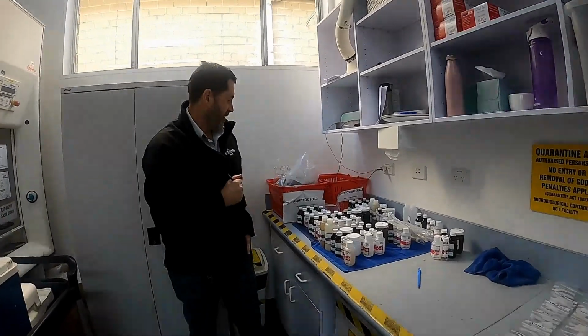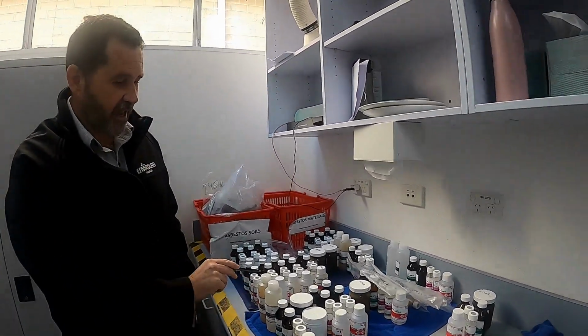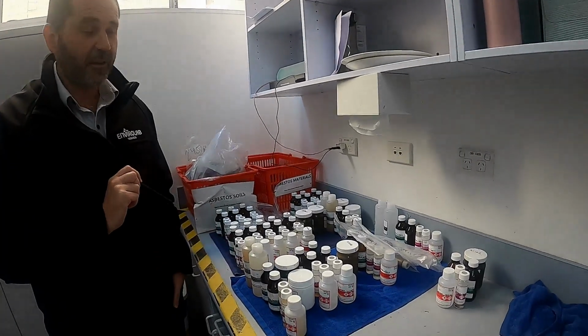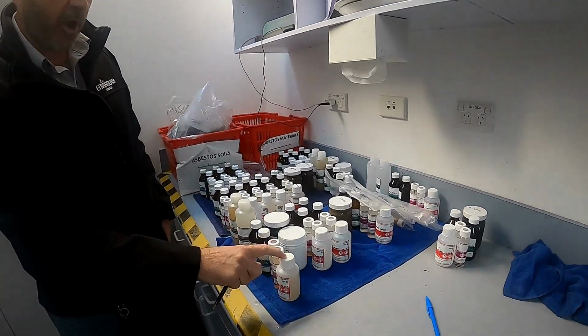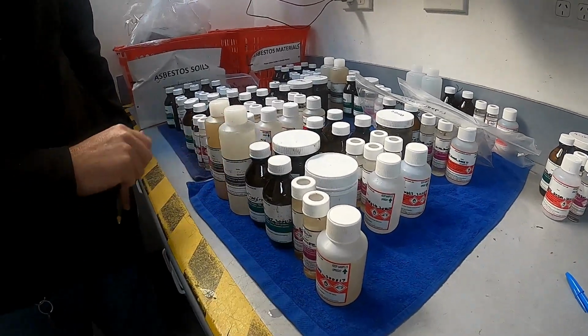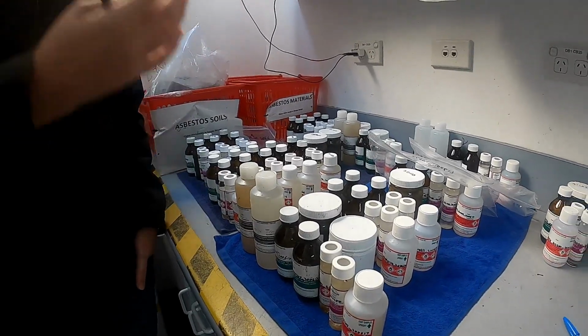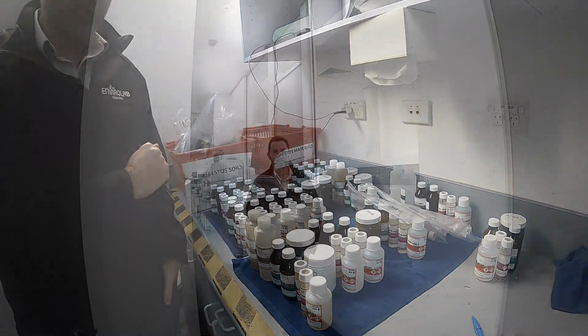Likewise, over here are our water samples. And you'll see here that every sample needs to be in a particularly preserved bottle. So we've got nitric bottles, sulfuric bottles, unpreserved bottles, and zinc acetate preserved bottles. Each different test has a different preservative.